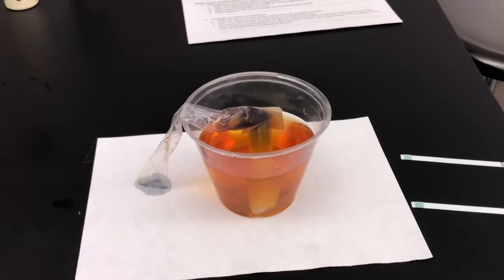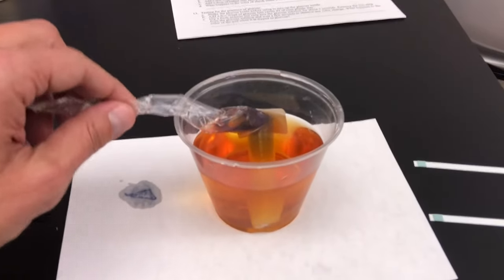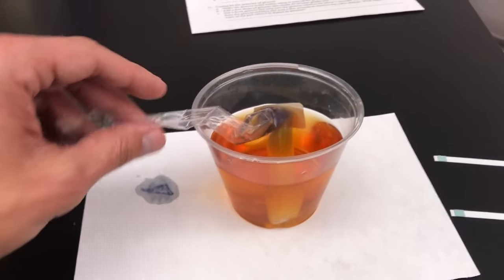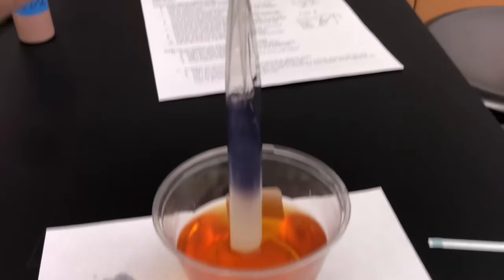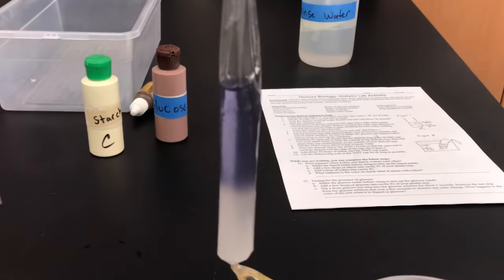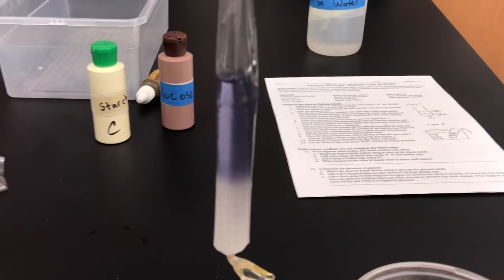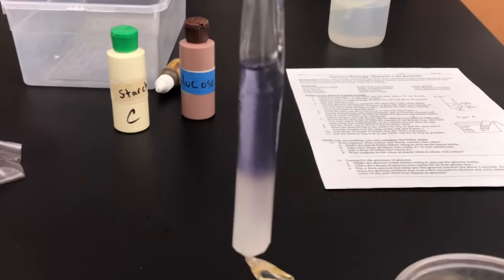Okay, here are the results. It's actually been a little over an hour, which is fine — the longer it sits, the more vivid the results. I'm going to hold up the dialysis bag. You can see there's a dark purplish color inside the dialysis bag that wasn't there before. Based on what we've seen in this video, you should be able to explain why that dark purplish color is now inside the dialysis membrane.